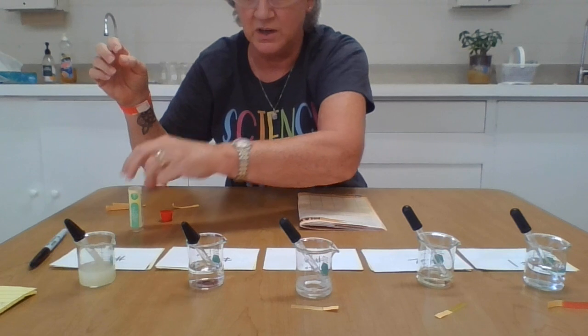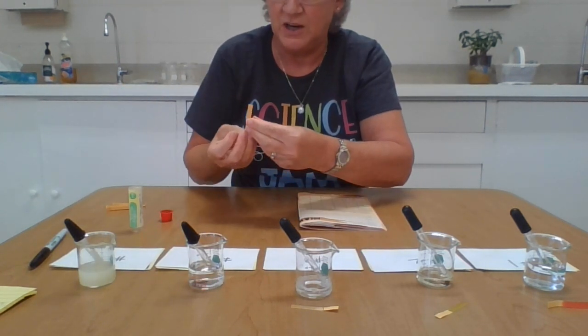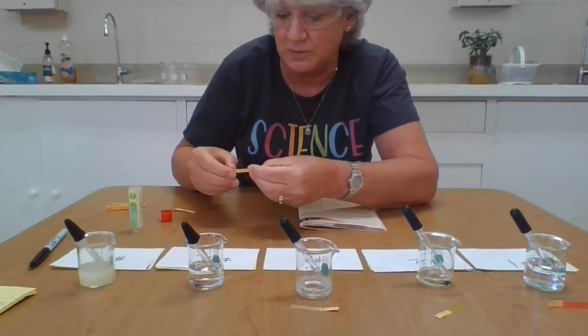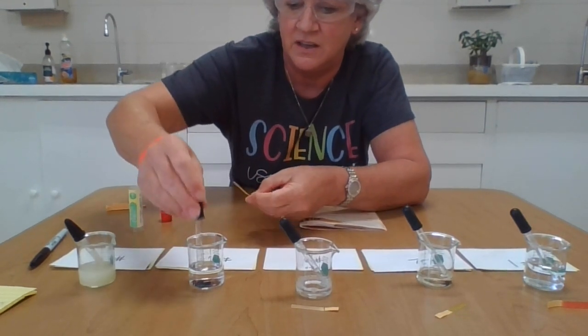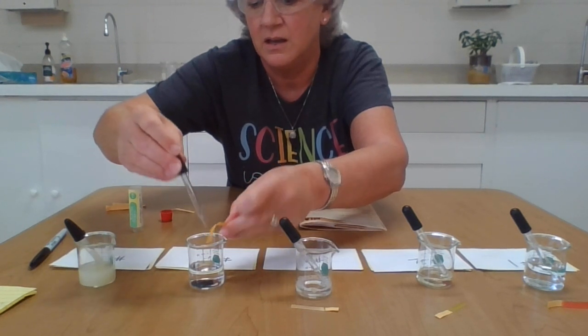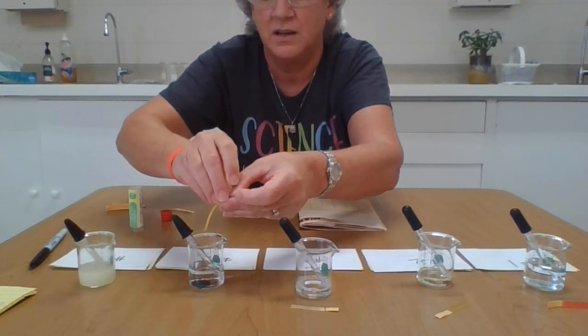All right, the next one, number 4, mystery substance. Get another clean paper, and I'm careful not to contaminate the papers with my fingers. I'm careful not to get the substances onto my fingers and touching the litmus paper because that could affect my results. All right, this one. Here we go.